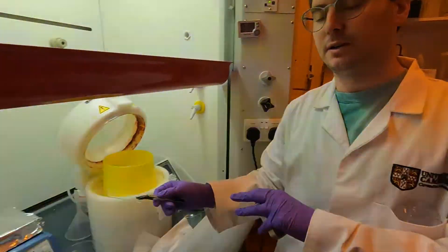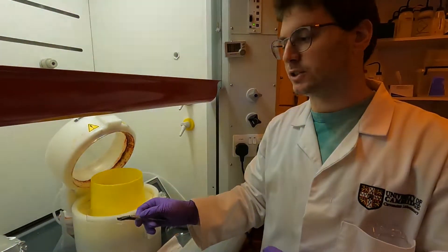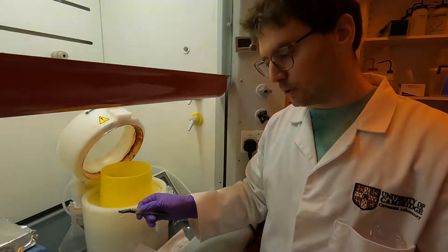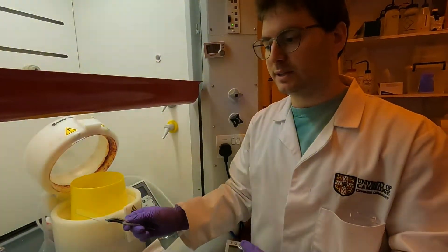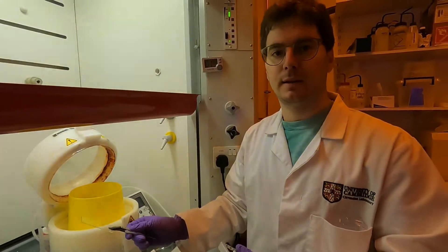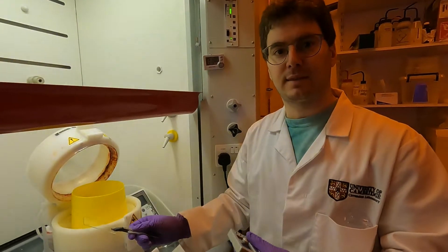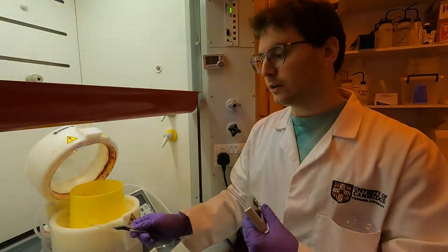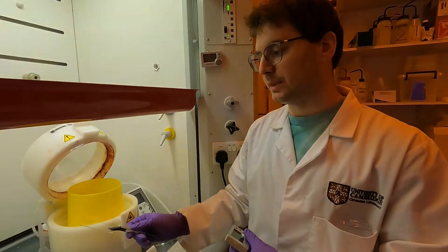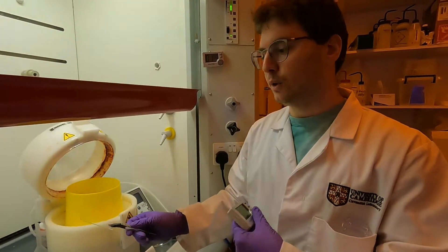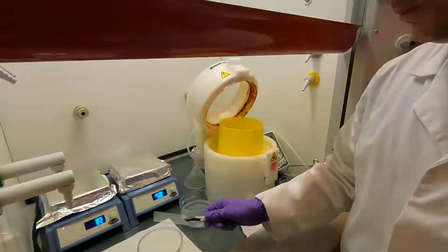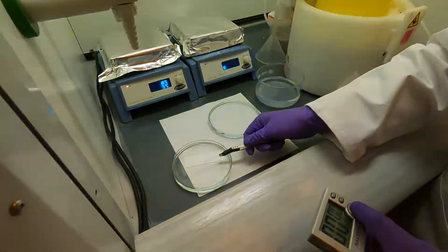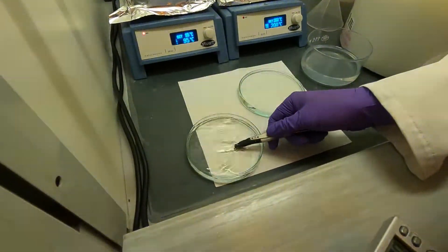I'm going to keep a timer ready. For the SU-8 2010, with the way I agitate the sample inside the petri dish, I'm expecting a development time of about one minute thirty to two minutes. I'm going to deliberately underdevelop the sample so you can see the effect of underdevelopment. I'm going to get ready with my timer, immerse it in, and start the timer.